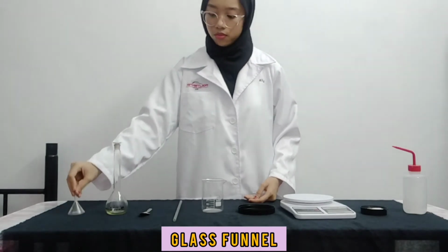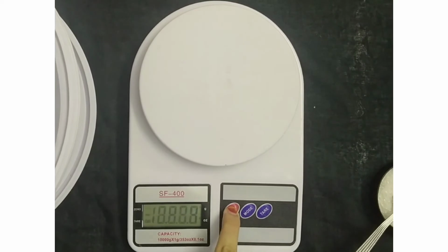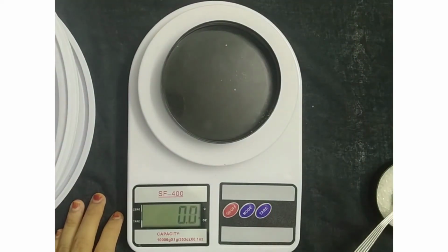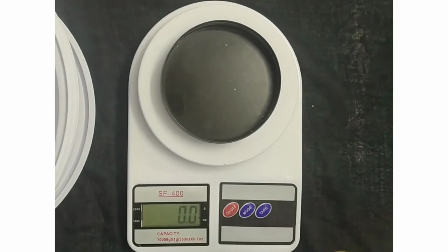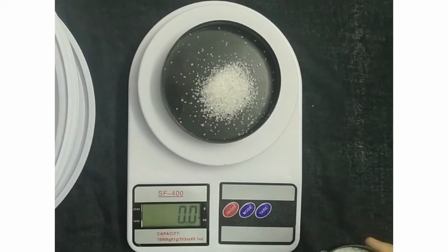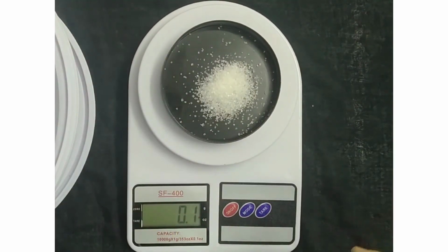So now, let's begin our experiment. Now, we need to weigh the amount of tyrosine that we already calculated before using a digital scale. The amount of tyrosine that we need is 0.5 gram. In this experiment, I will replace the solute tyrosine with sugar.